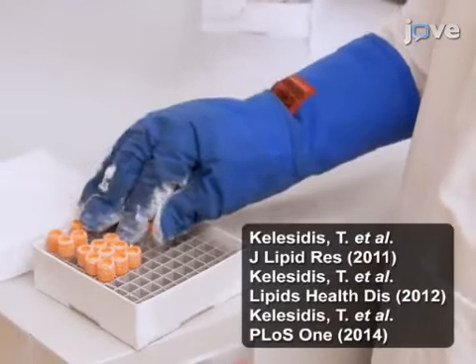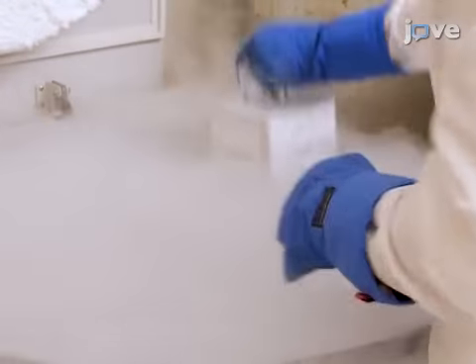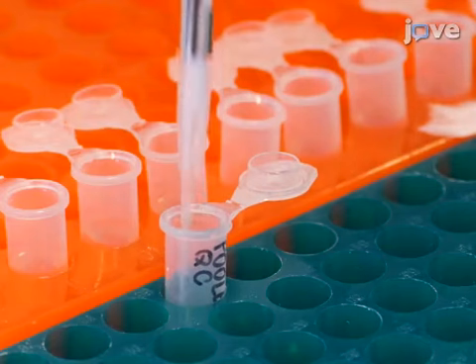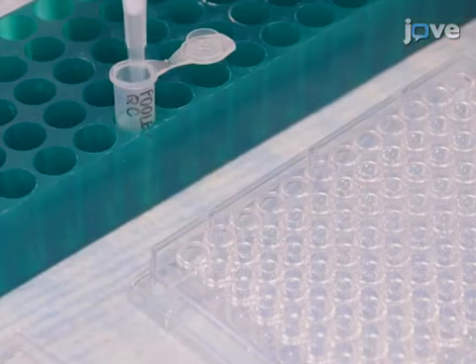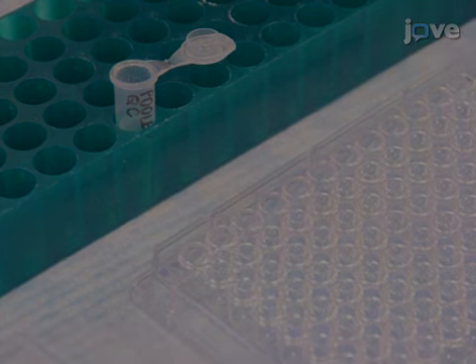After preparing a large stock of HDL, cryopreserve several aliquots to minimize freeze-thaw cycles. Pool at least 10 different replicates to create a pooled quality control. Then determine the average value of HDL-ox as outlined in the text protocol.